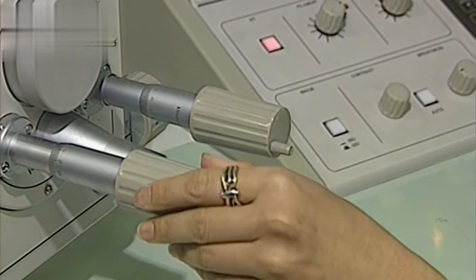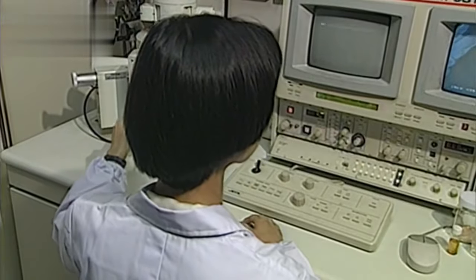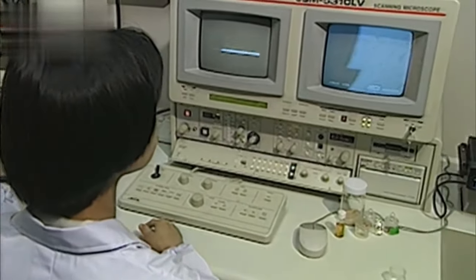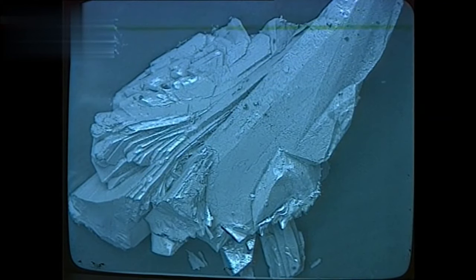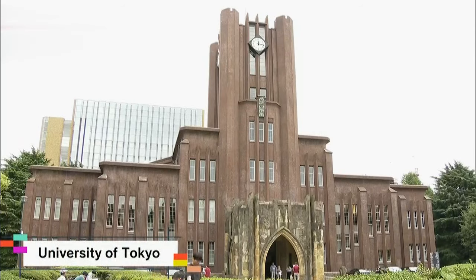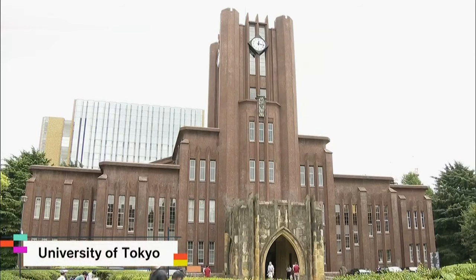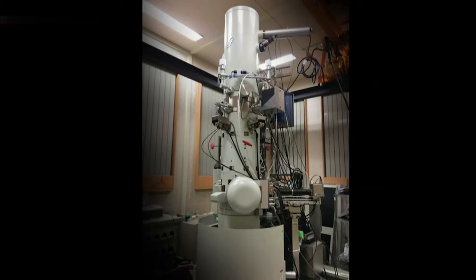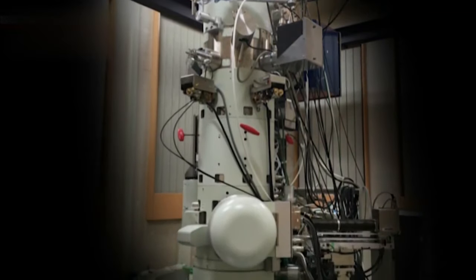Since then, the company has worked with university researchers worldwide to improve and continue developing the microscopes. In 2017, in cooperation with the University of Tokyo, they developed an electron microscope that broke the world record for magnification.